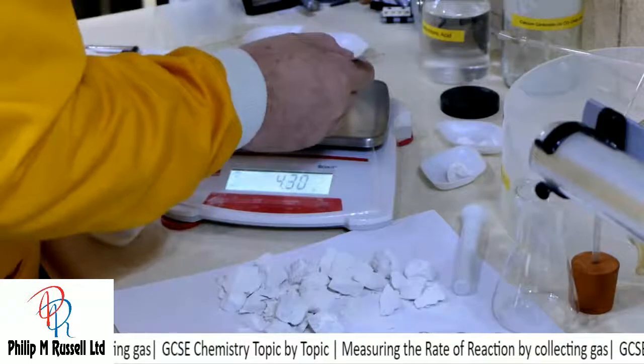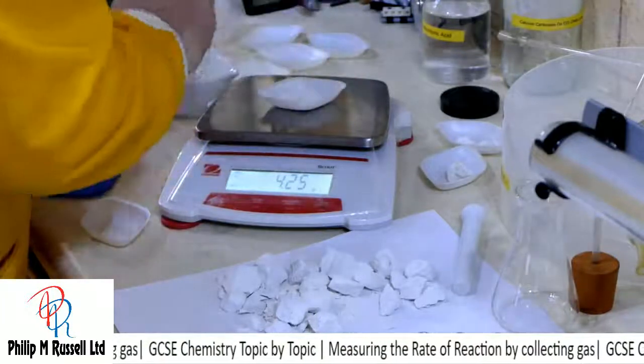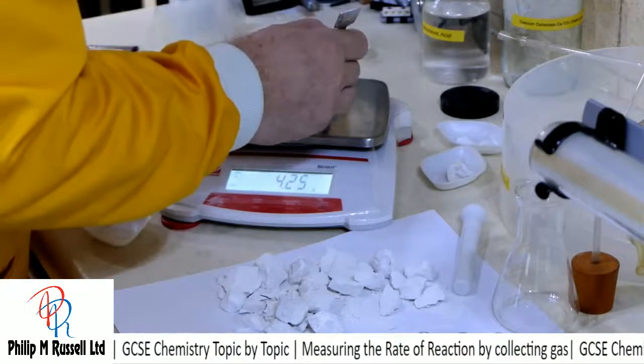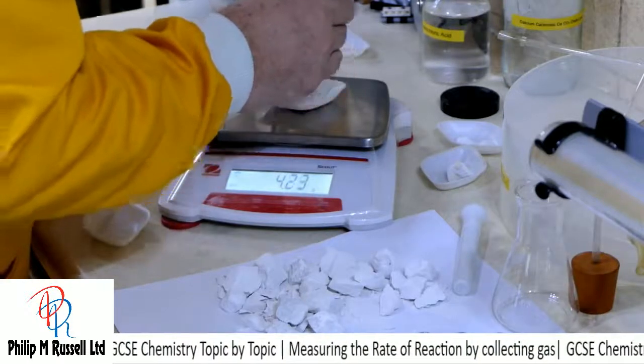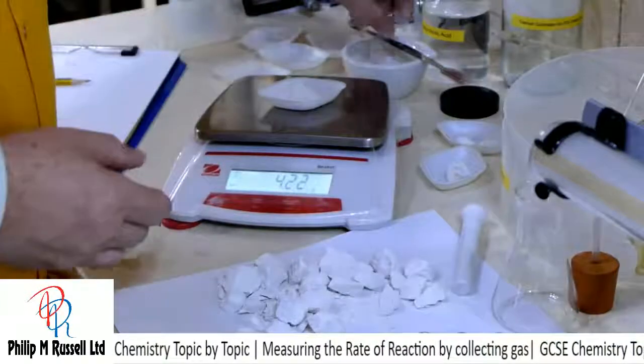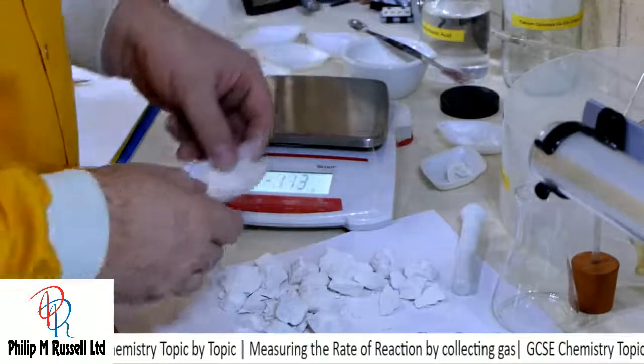There we are, went up to 4.29. There we are, 4.22. So pretty accurate that's going to be.